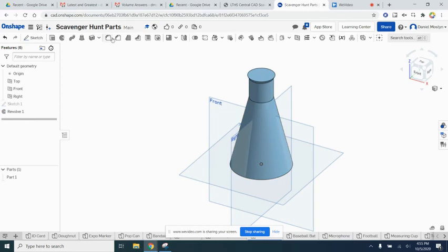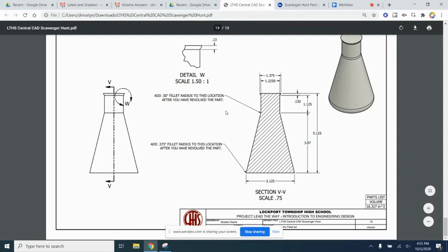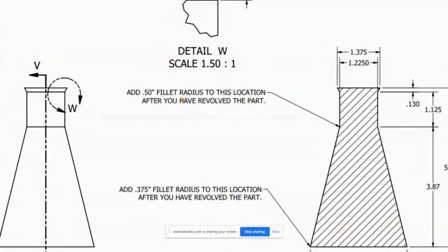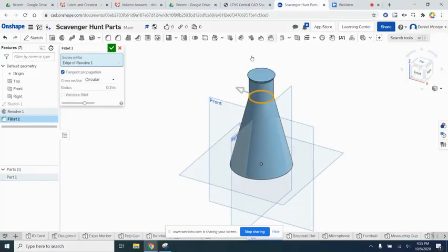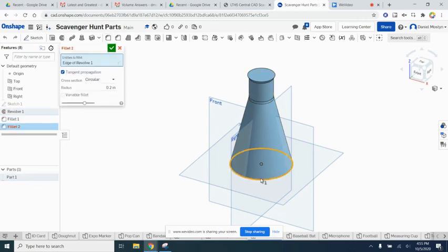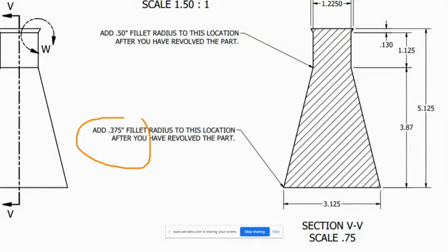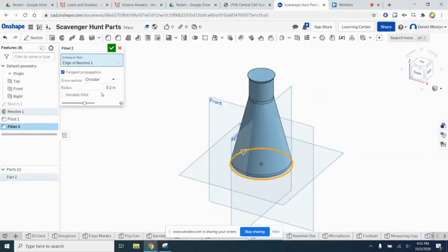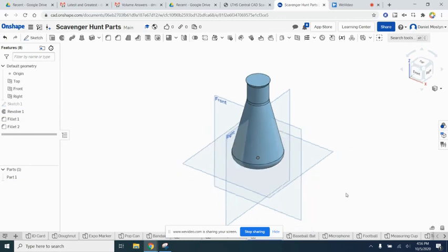The last thing is to put a few fillets in. So we have a fillet right there. Let's check that out. It's a rounded off edge. And this inside edge that we're rounding off is at a 0.50 radius. There we go. That's rounded off right there. Let's do another fillet at the bottom to round off the bottom. This fillet is going to be a 0.375 inch fillet. And there we go. That looks like a darn good chemistry flask. Beautiful.